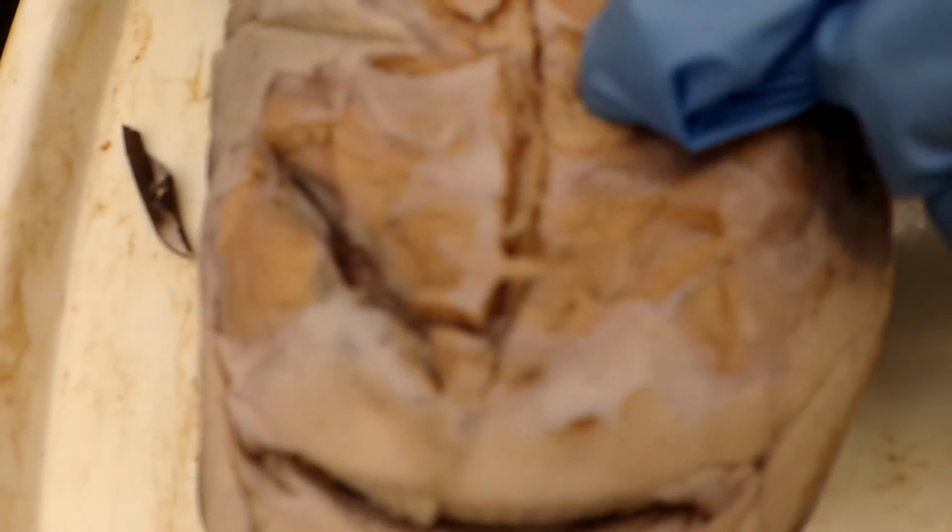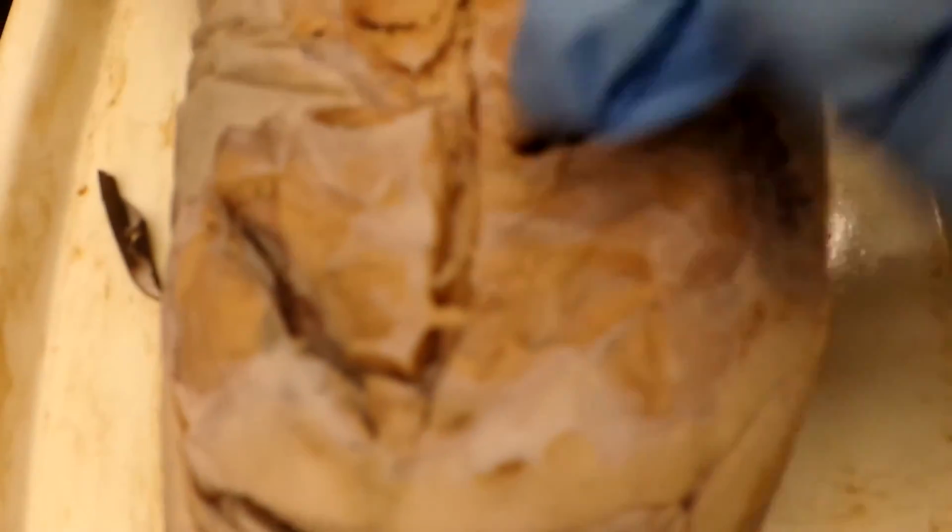First is the coracomandibularis, which is in the middle, on the left side of the groove. The origin is the fascia of the coracoarcual muscle. The insertion is Meckel's cartilage.